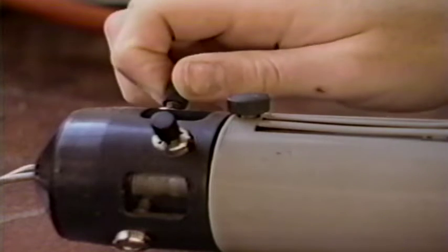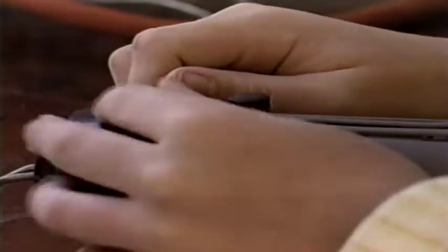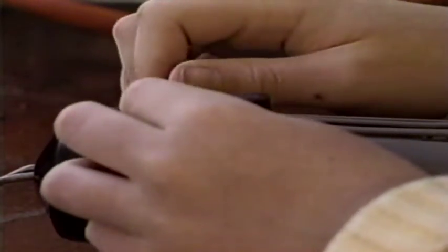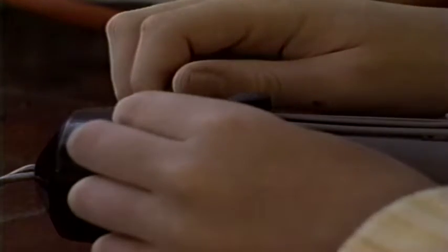Now, fine-tuning of the light can be achieved by opening and closing the iris diaphragm and adjusting the rheostat. If the area of maximum brightness is off-center, it can be adjusted by the use of special centering control knobs. In this microscope, they are mounted on the light source. By turning them, the light beam can be fine-centered.